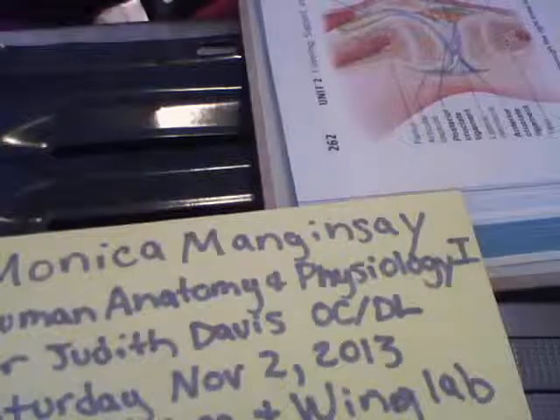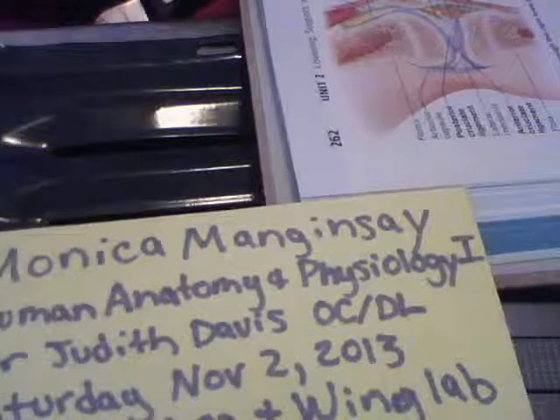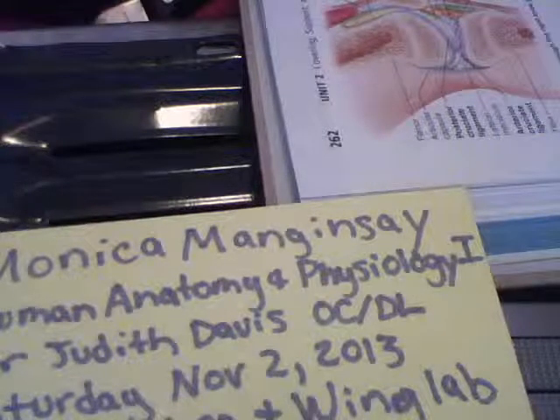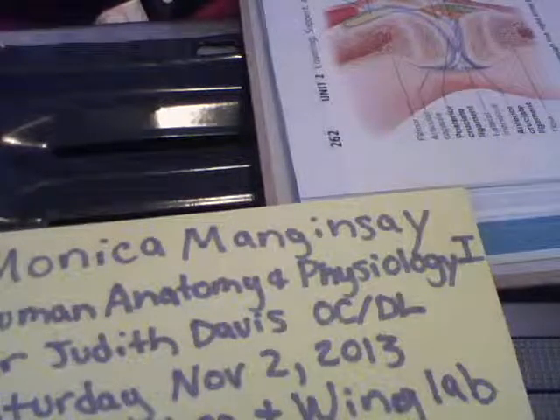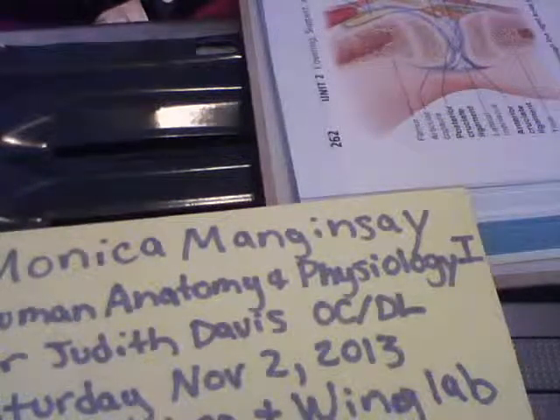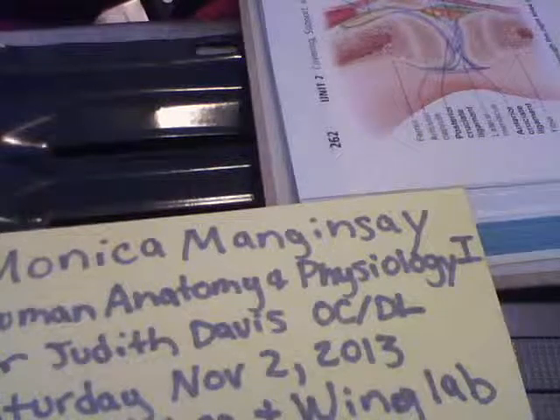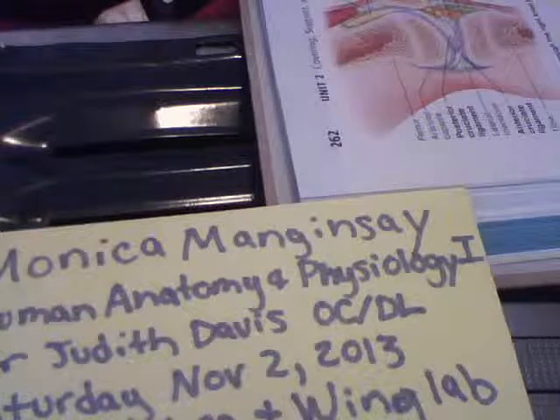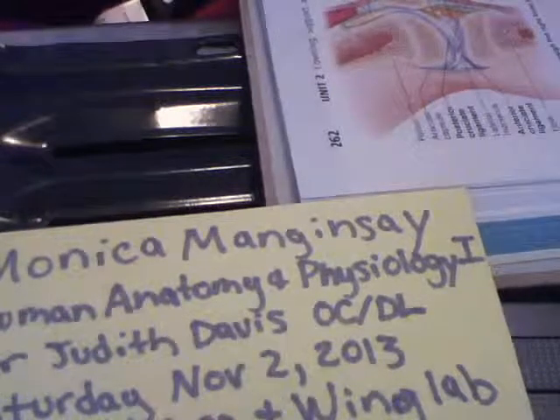The knee joint is unique in that its joint cavity is only partially enclosed by a capsule. The relatively thin articular capsule is present only on the sides and posterior aspects of the knee, where it covers the bulk of the femoral and tibial condyles.